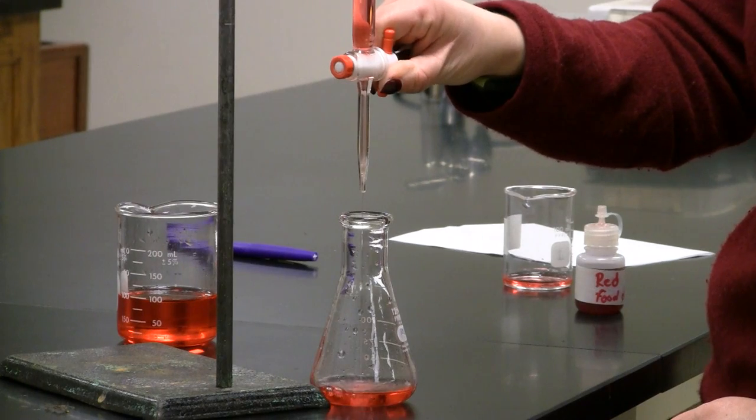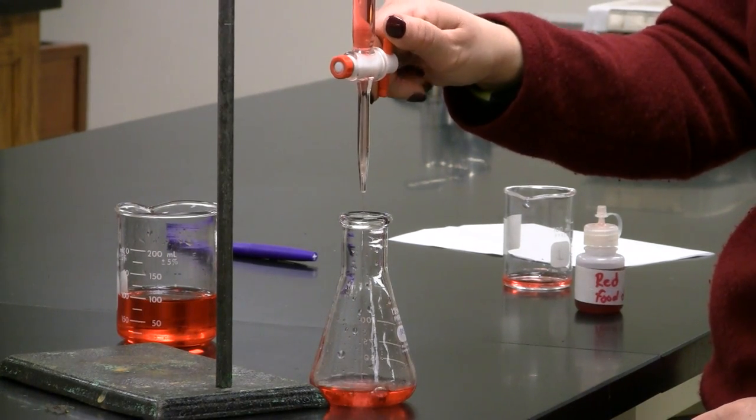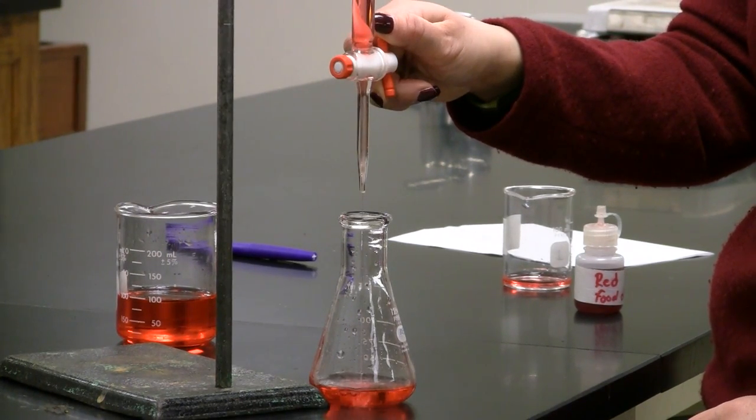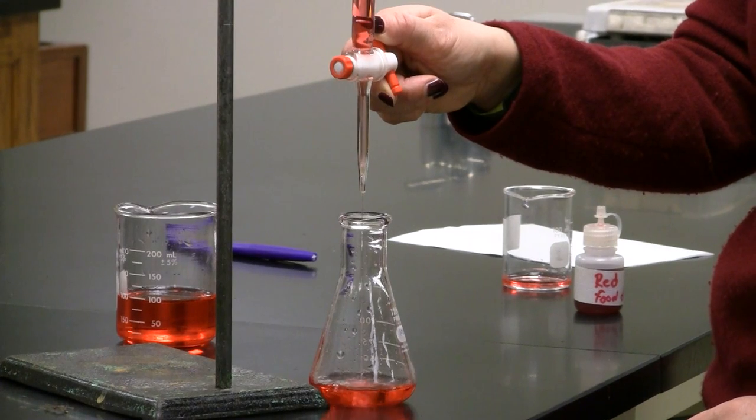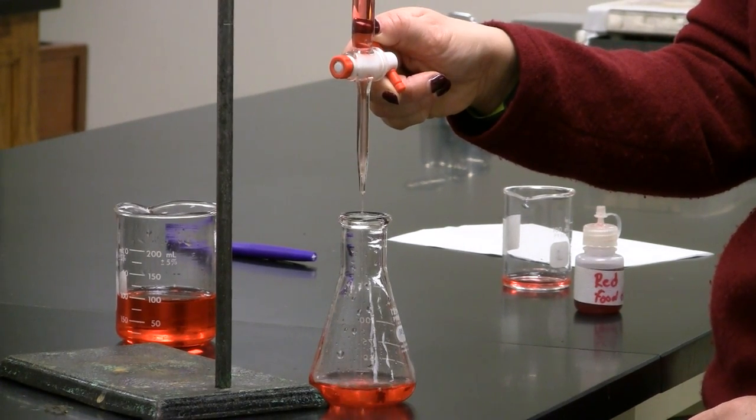It's okay to begin quickly, then slow down the flow once you near the desired volume. For some experiments, you may need to add single drops or even half drops to dispense the exact volume needed.